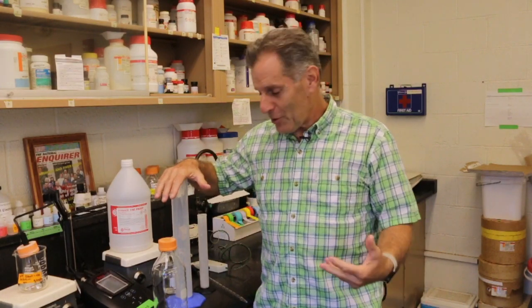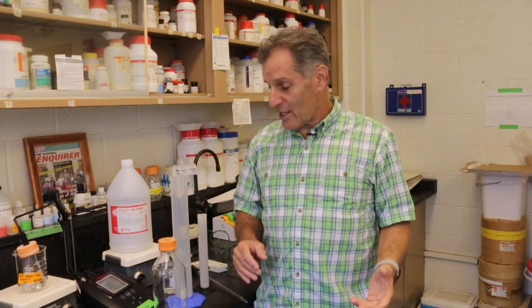All right, this is 500 mils, but it's a liter. If I measure out a liter of water, that's 1,000 milliliters, and 1,000 milliliters weighs 1,000 grams, which is a kilogram, a kilo. This is the great thing about the metric system, it's really easy to go back and forth. In the laboratory, it makes it really simple to go back and forth between one unit and the other.